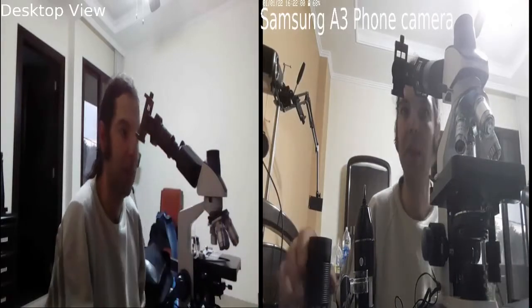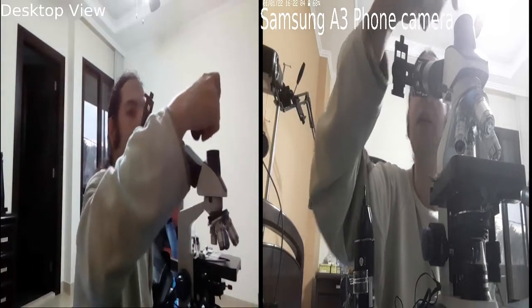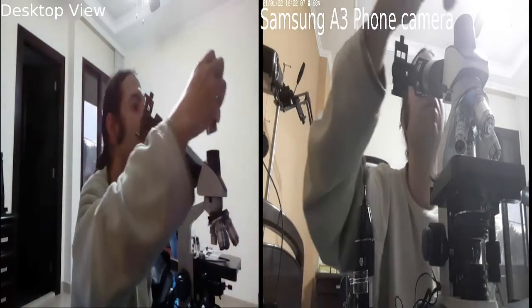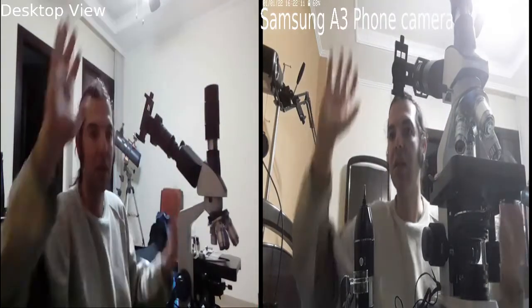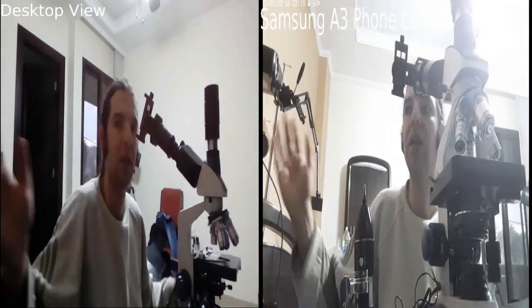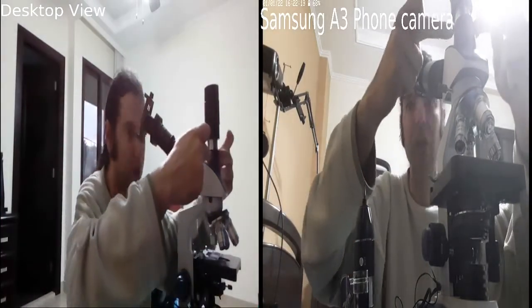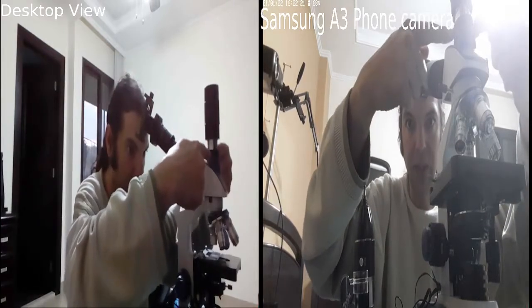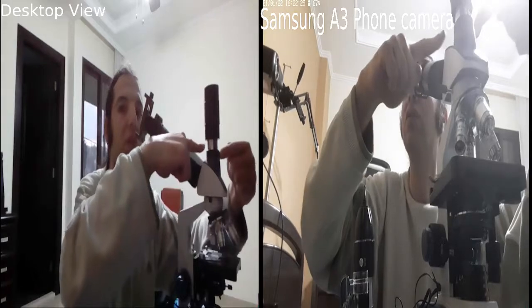Okay, so remember, don't scratch the glass inside. There is a lens inside, don't scratch it. Just leave it like this and use your eyes by looking. Don't push it or anything. It's not fastened. There are no screws to hold it, no screws like this.